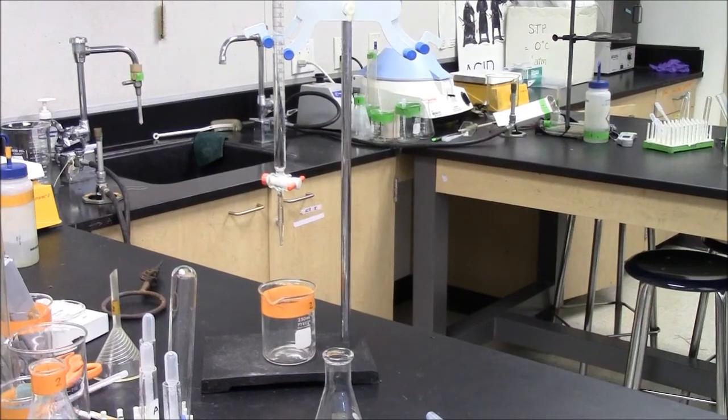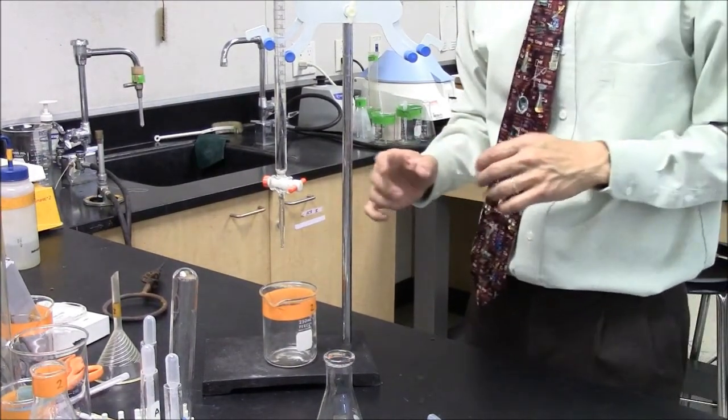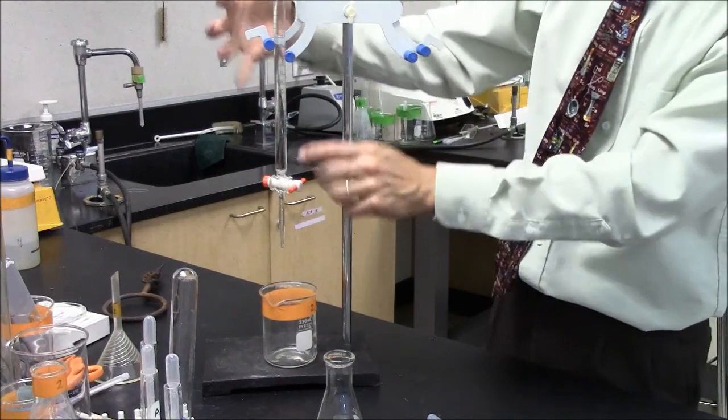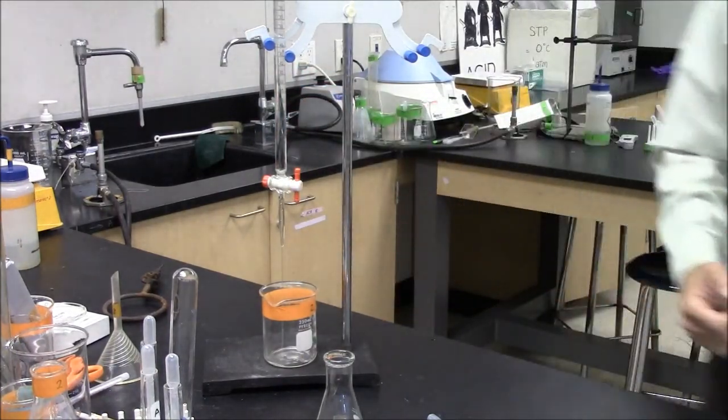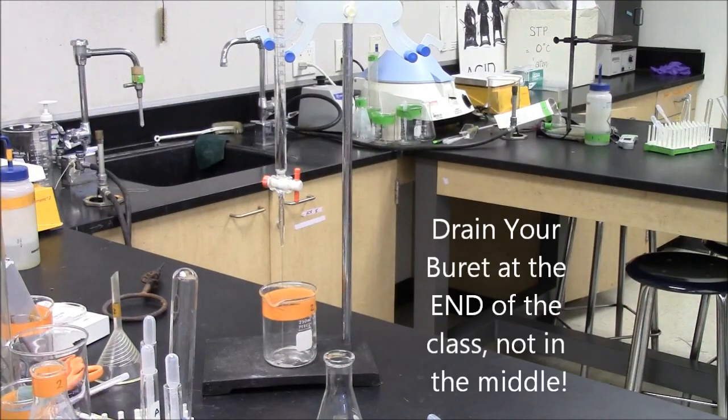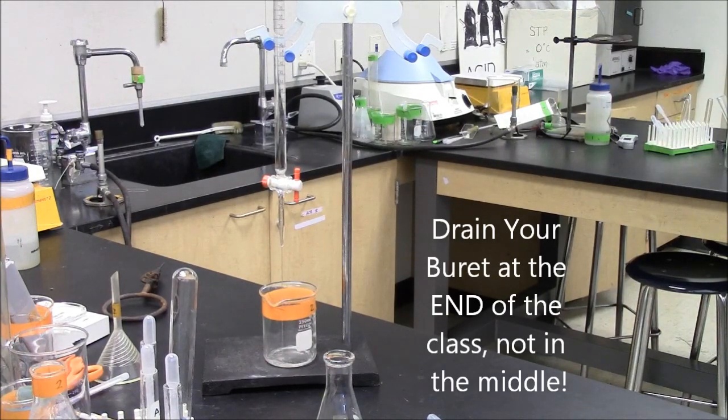At the end of the hour when you're done with all your titrations, your pink solution should go down the drain. The material left in your burette should be drained into a waste beaker. Leave an empty burette for the next class please.